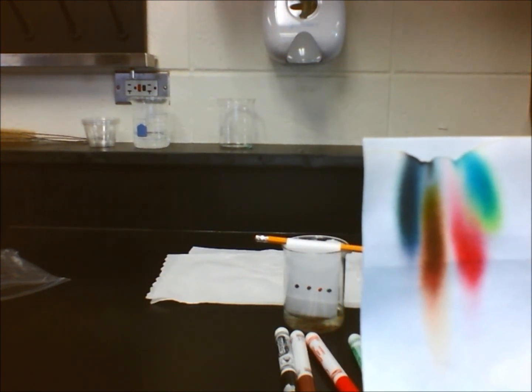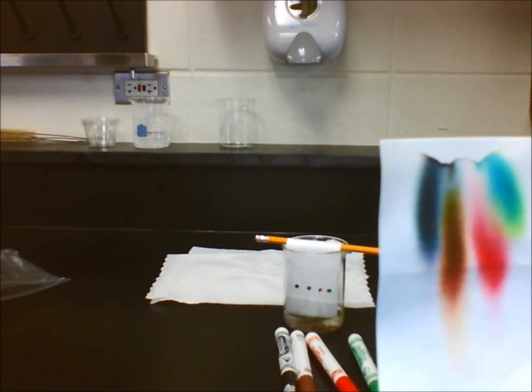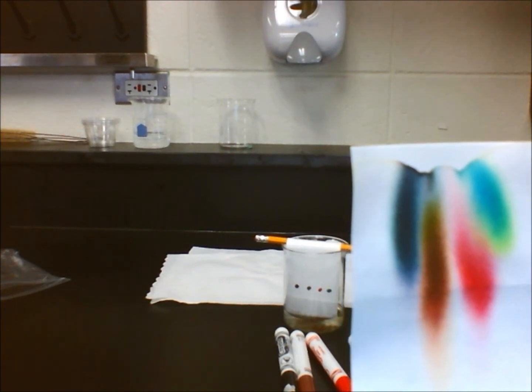Students must realize that dyes of the same color do not always behave the same way. Here, the red solutes found in the brown marker and red marker seem to have similar solubility rates. However, not all red dyes will dissolve at the exact same speed.